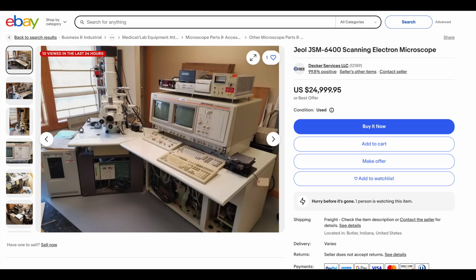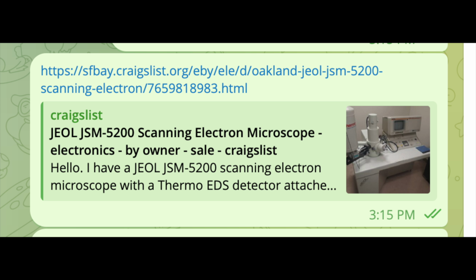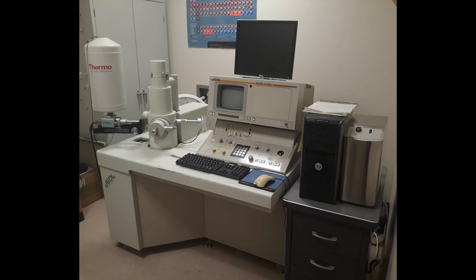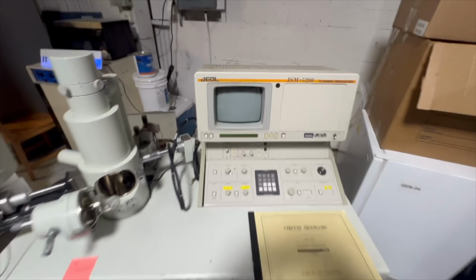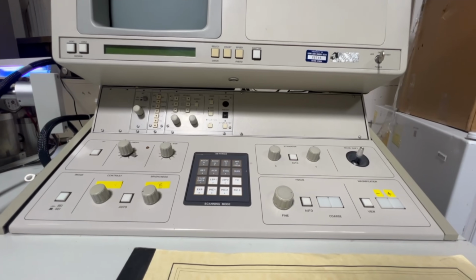I found a few potential candidates over the years, but they were all either too expensive or entirely broken. However, about a year ago, I stumbled upon a small scanning electron microscope on Craigslist of all places. It was made by a company called JEOL in the 80s and 90s. It was relatively small for an SEM at least. Only about 800 pounds and the size of a single desk. However, when I inspected it in person, I found that it was totally non-functional.